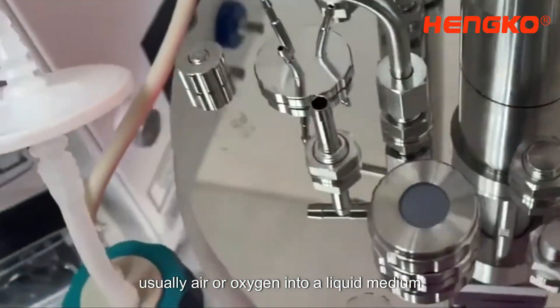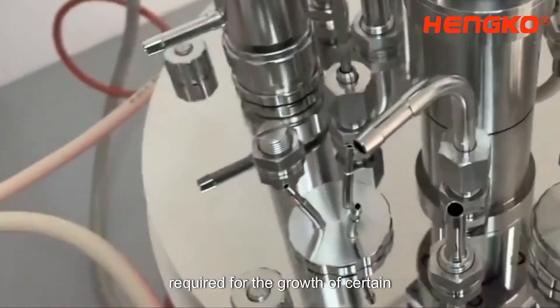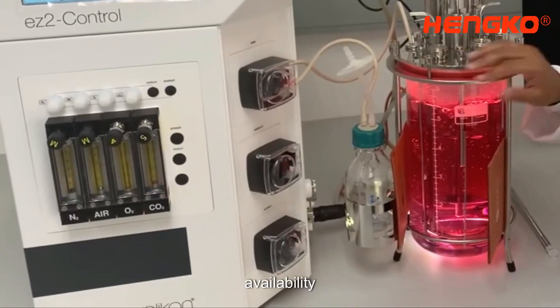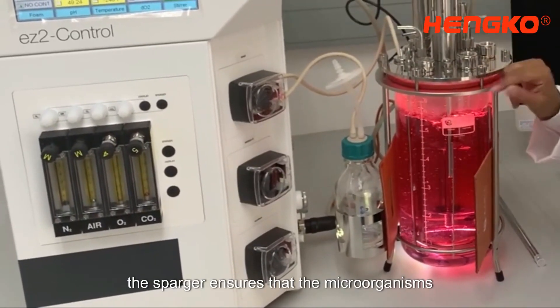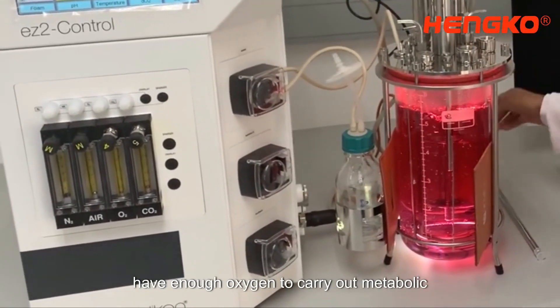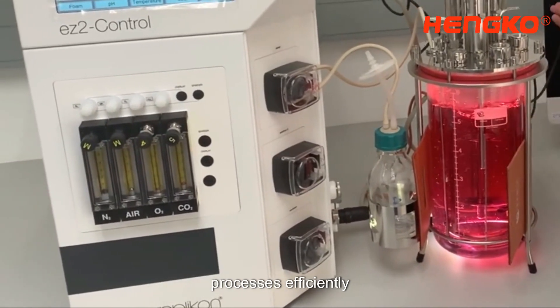Required for the growth of certain microorganisms that depend on oxygen availability, the sparger ensures that the microorganisms have enough oxygen to carry out metabolic processes efficiently.